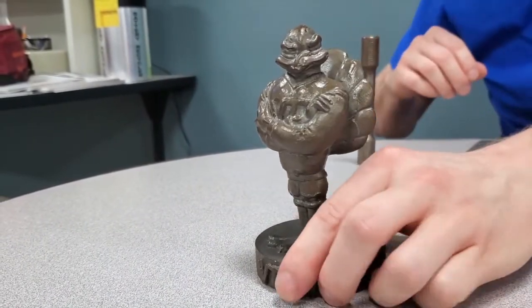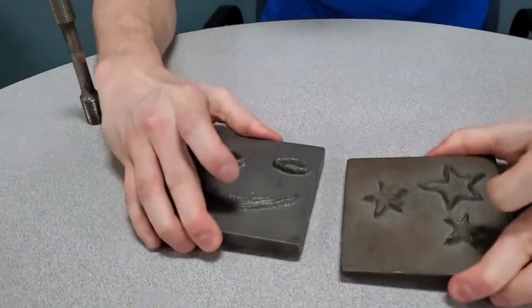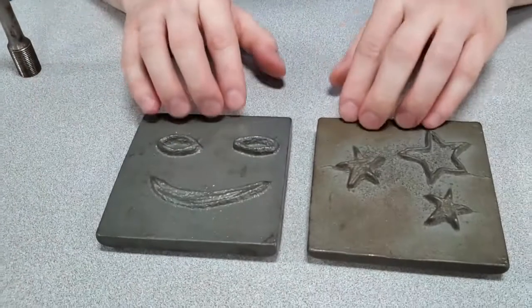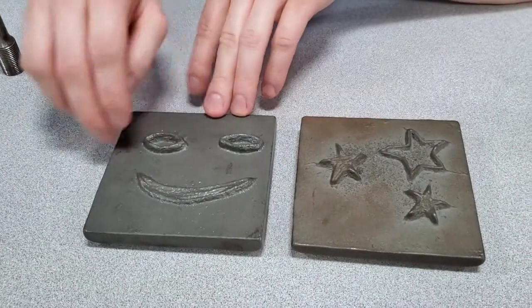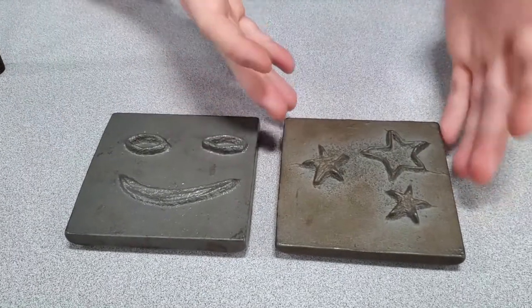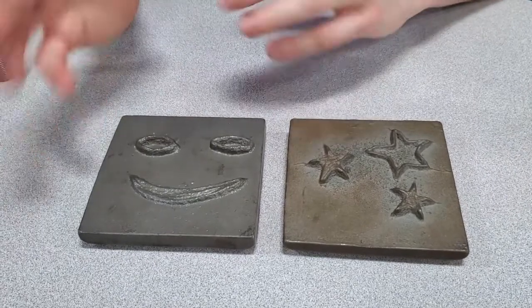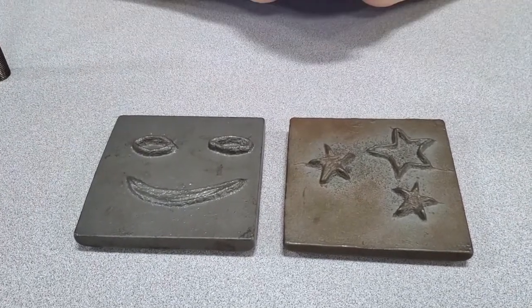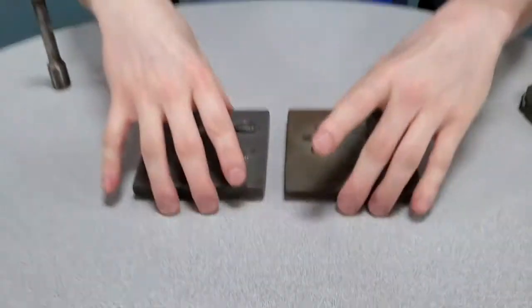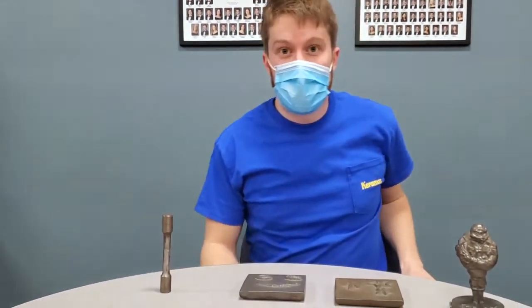Here are 2 more examples of cast pieces. What I wanted to talk about here is that these 2 pieces are approximately the same age, but one of them was covered in a protective enamel and the other one was not. You can clearly see that the one that was not covered is starting to corrode at a much faster rate than the one that was protected, which is why we use these sorts of protective coatings on metals, to keep them going.